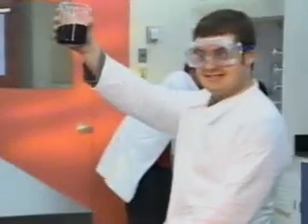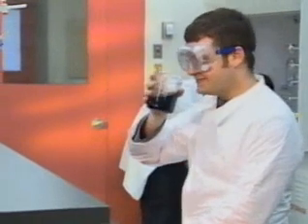Unfortunately, we've also seen some of those things that can happen when you don't play smart. Like this joker, drinking from the lab equipment. Yeah, but we've seen that those things can be avoided if these folks just use good lab safety technique.